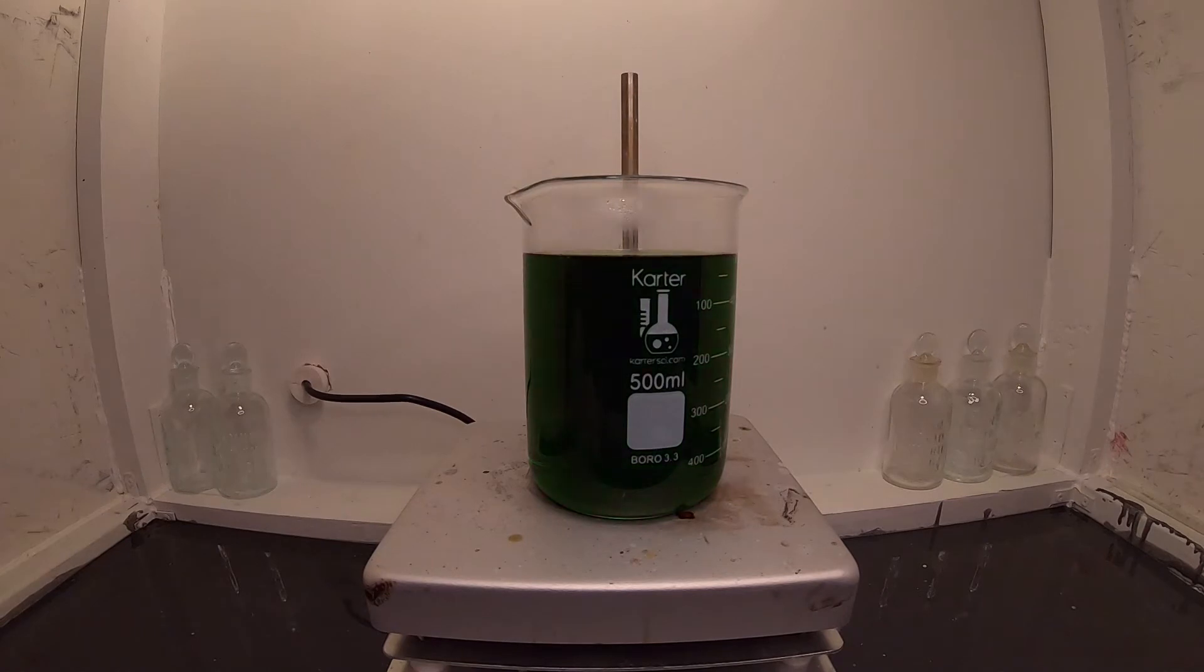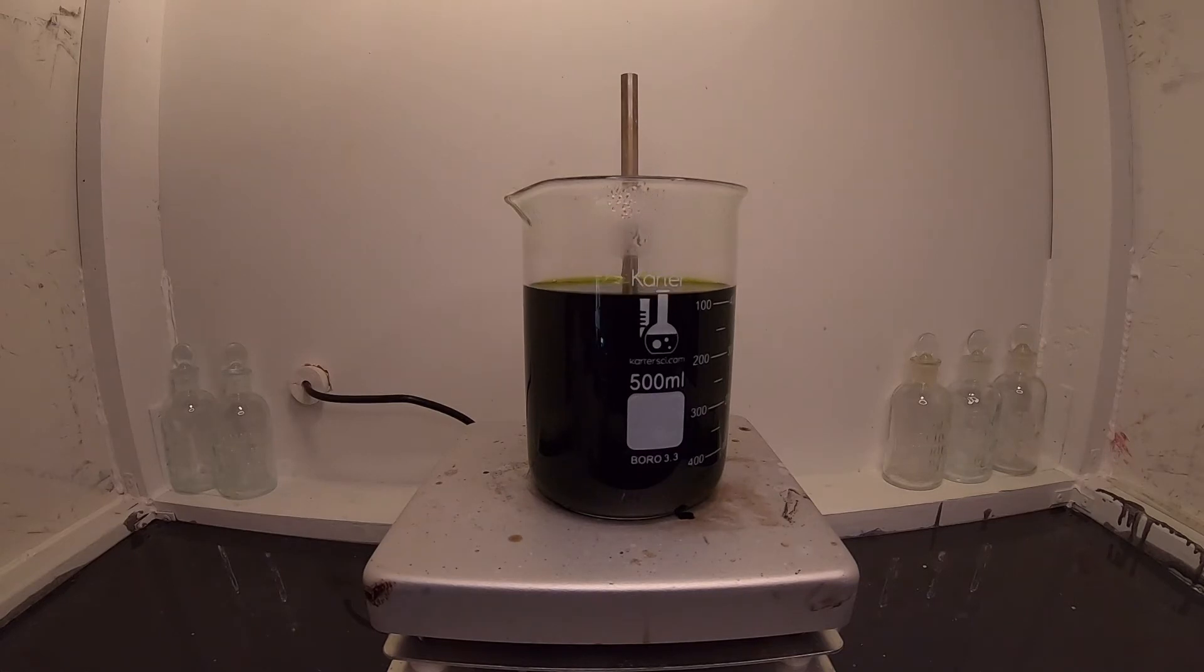Now we need to evaporate off the liquid to gather the copper chloride crystals. This is going to take a while.